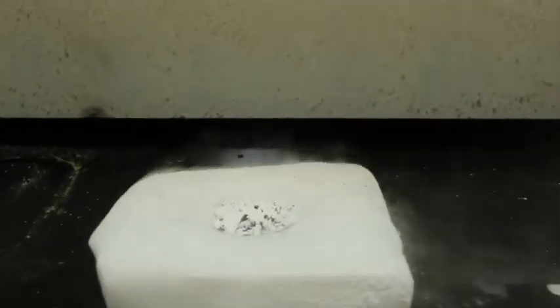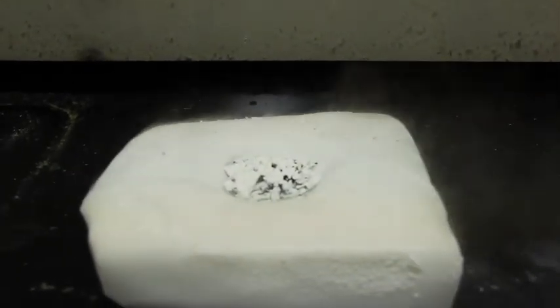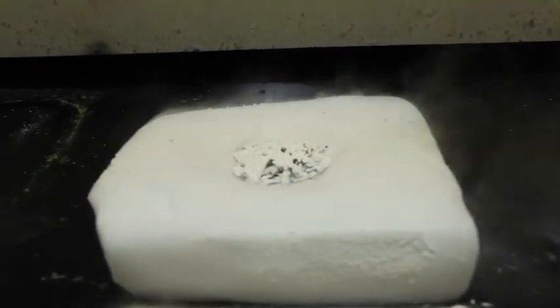Oh. That would have been hard. I think it would have just lasted. Well, yeah. This is like 30 seconds. That was the longest hole.